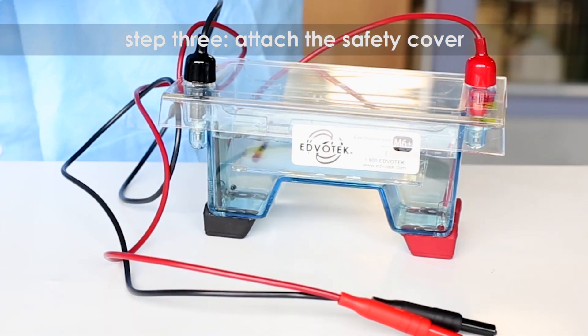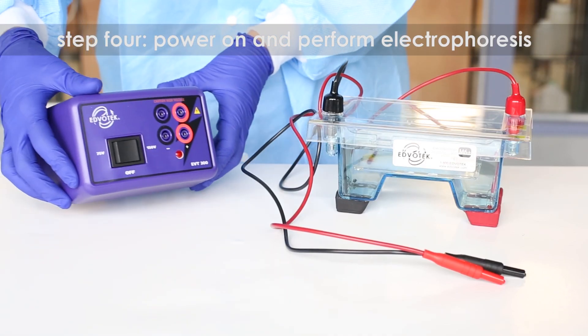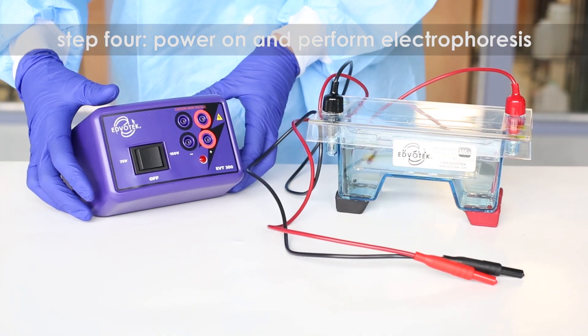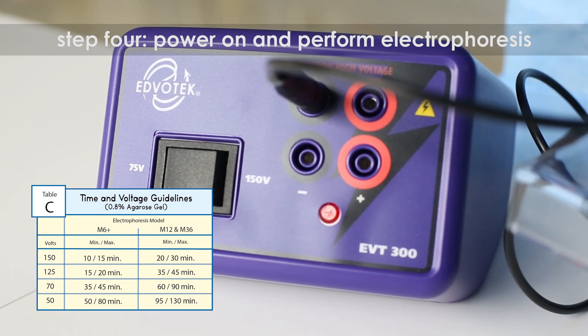Step four: connect leads to the power source and perform electrophoresis. Refer to table C for time and voltage guidelines.